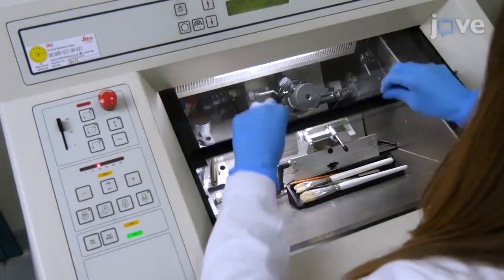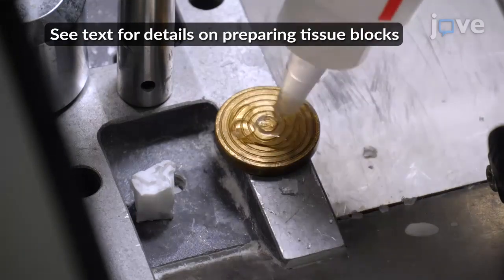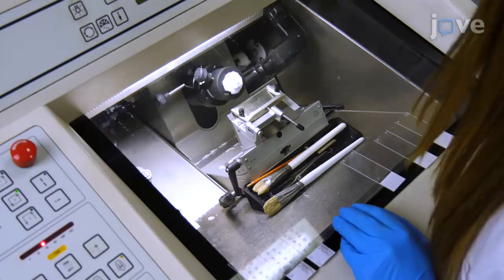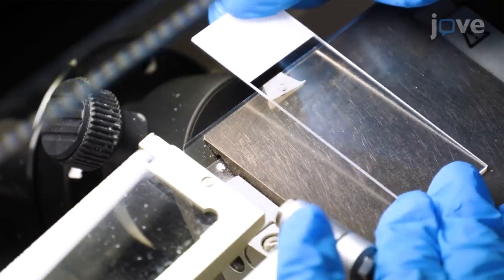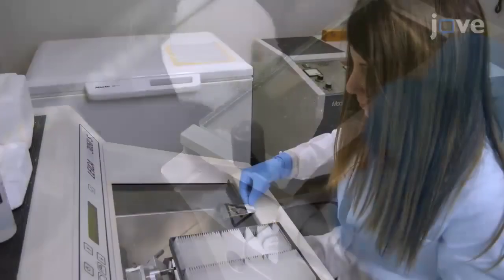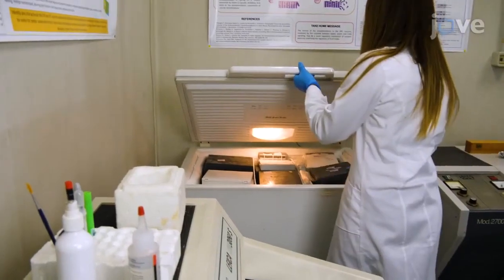To begin this procedure, transfer the prepared frozen tissue blocks to a cryostat at -20 degrees Celsius. Cut the block in coronal or sagittal sections of 10 micrometers. Then, collect the tissues in alternate serial sections onto adhesive glass slides suitable for immunohistochemistry and store them at -20 degrees Celsius until ready to proceed.